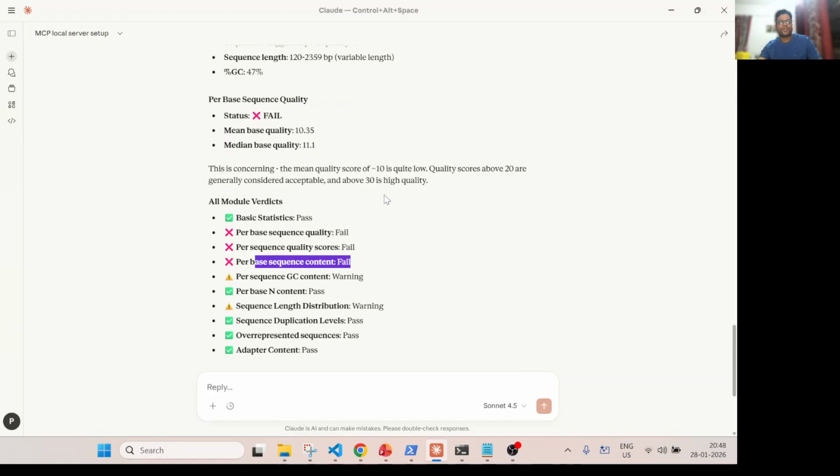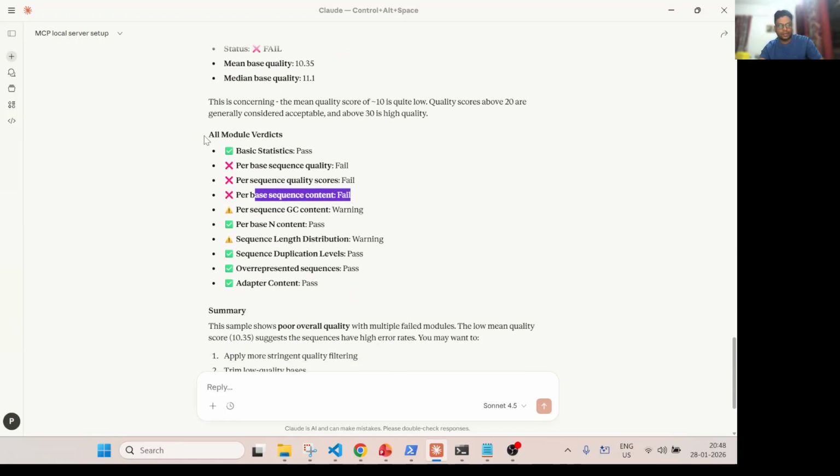So we'll say that, hey, you run this one, you find all these verdicts, at least per base sequence quality should be good, the average should be greater than 30. So whatever the way you analyze as a human, the same way you can document for an agent, and you store it in a skills file, and then your agent can follow that skill to use this MCP server.